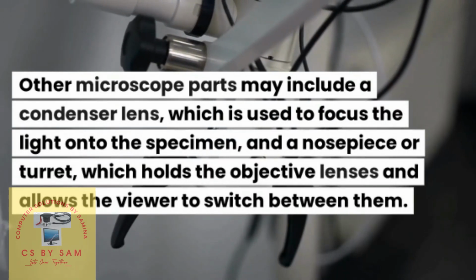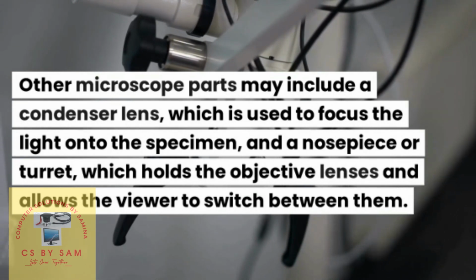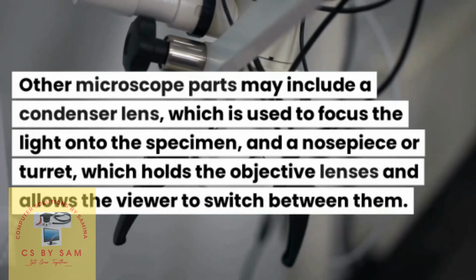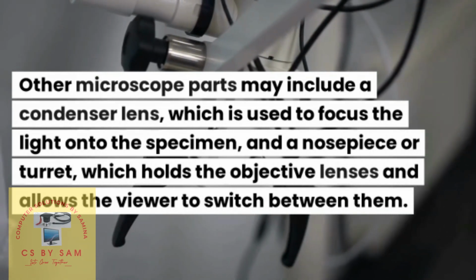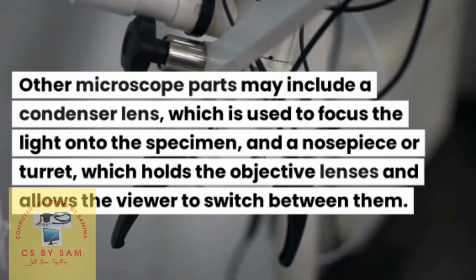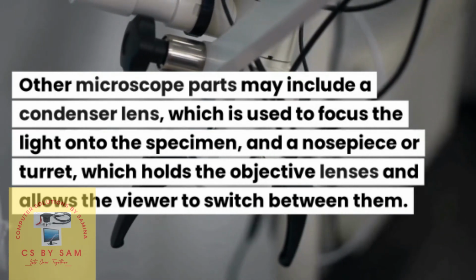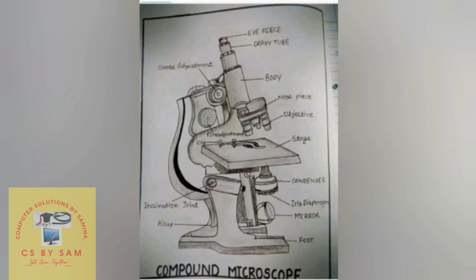Other microscope parts may include a condenser lens, which is used to focus the light onto the specimen, and a nosepiece or turret, which holds the objective lenses and allows the viewer to switch between them. Now you can see a labeled diagram of a compound microscope. Almost all parts of the microscope are labeled here, and you can ask any question in case of any difficulty.